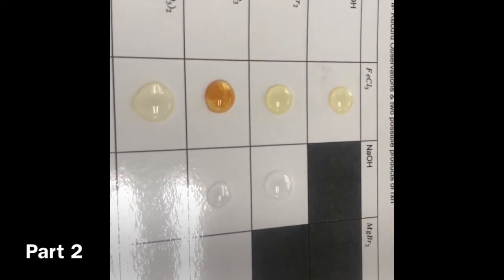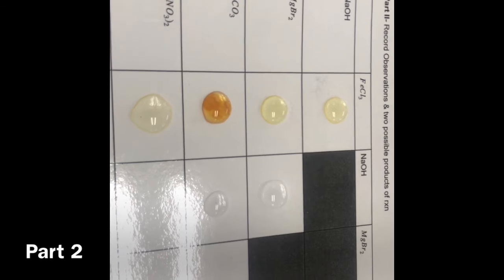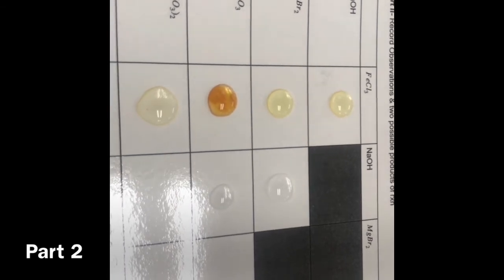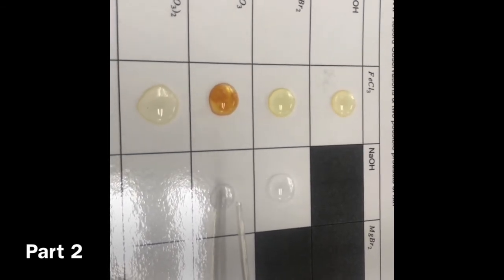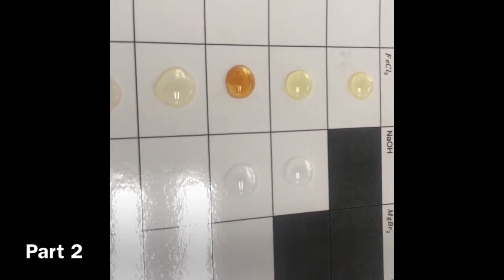Alright, and then what's the next? Let's see what happens with this one here. Oh, very not changed. Incredible, you guys. Incredible.